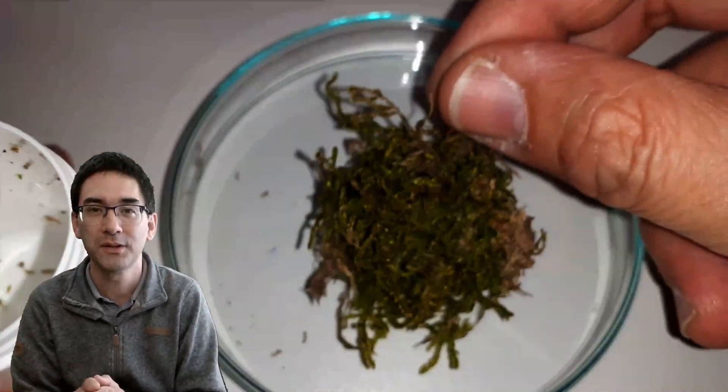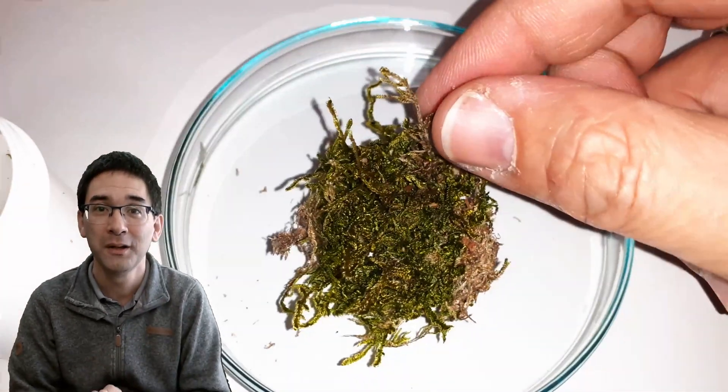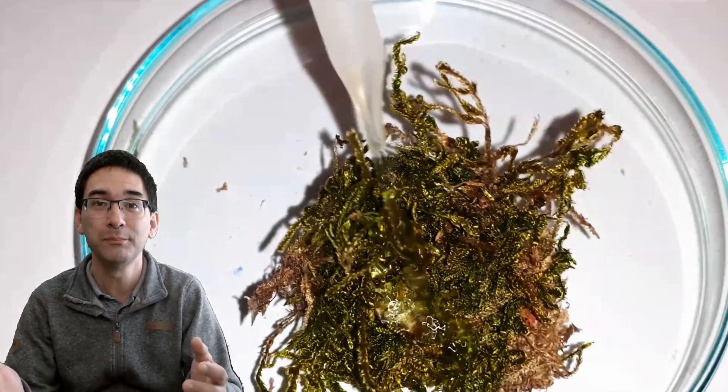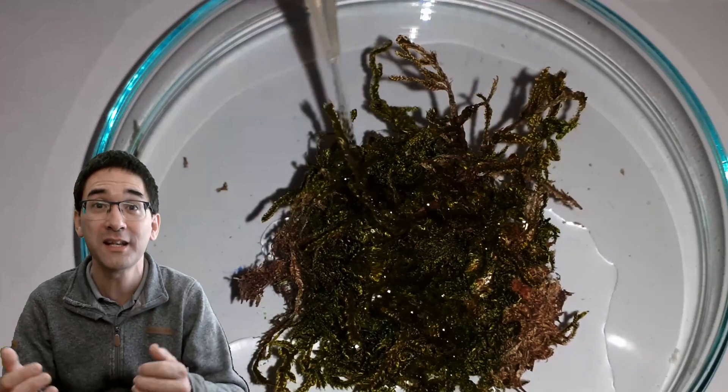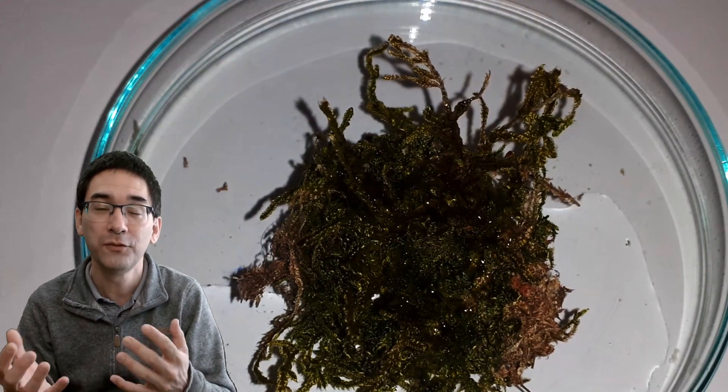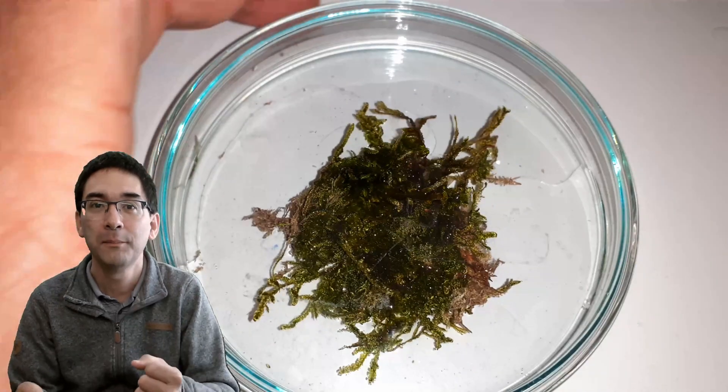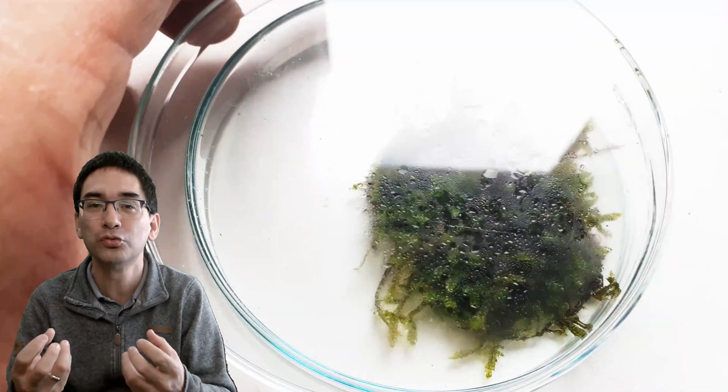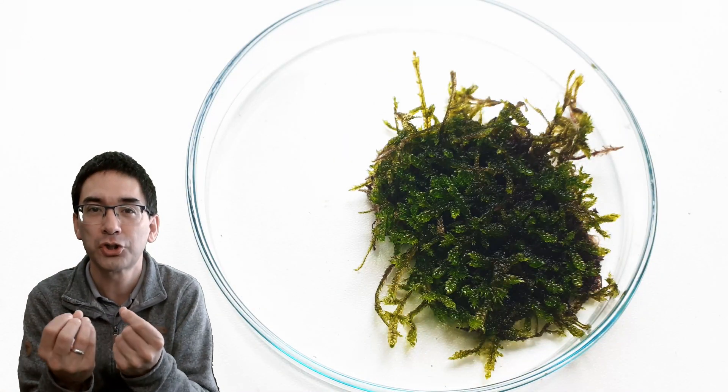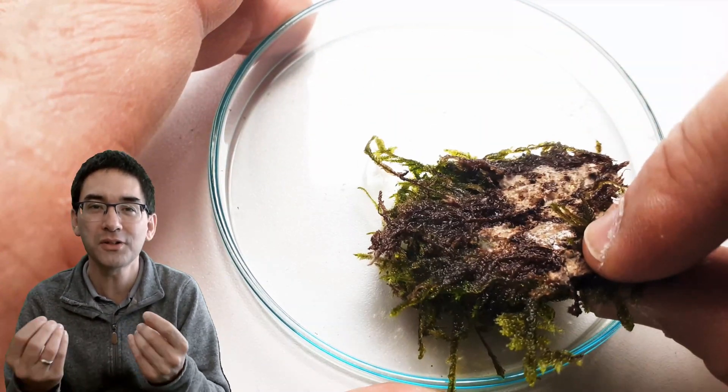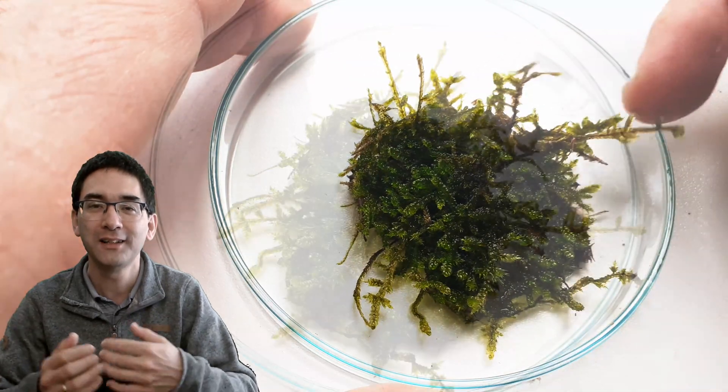And this takes a little bit of time. And so you have to be a little bit patient here. So the moss was completely dry and I added a little bit of tap water and simply let it stand for a few days, three days, four days, five days, maybe. And I could see a few things here. First of all, the moss absorbed all of the water, obviously, but it also changed color. It got much greener and much more lusher, of course.